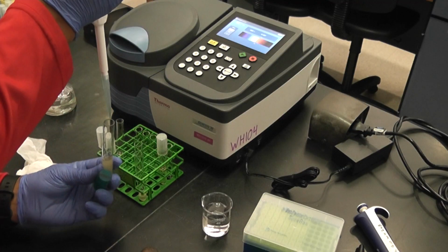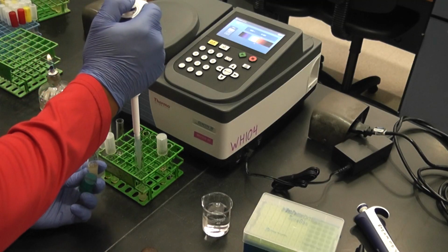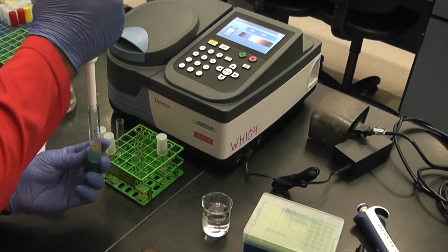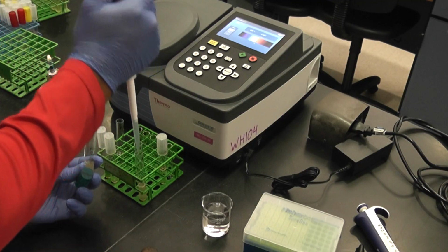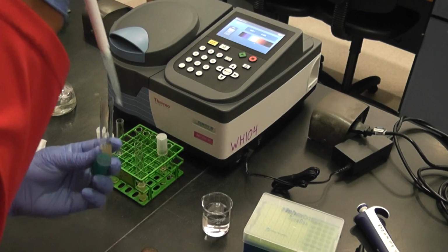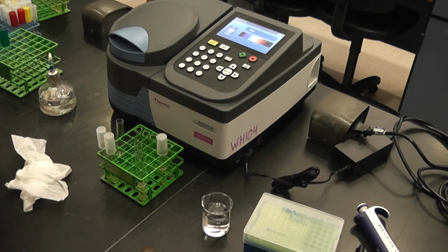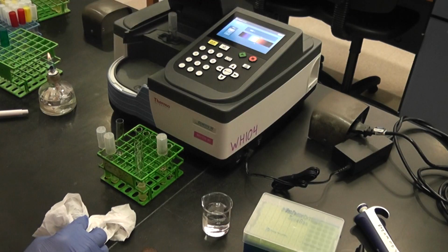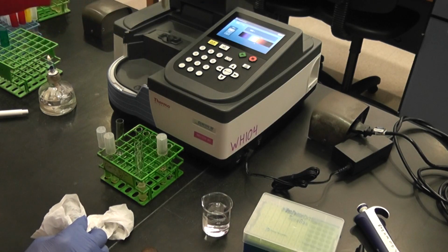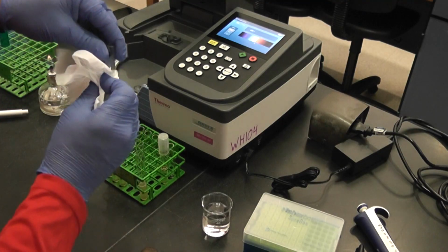One, 2, 3. So that has 3. I'm going to make sure I blank this again using my sterile water.